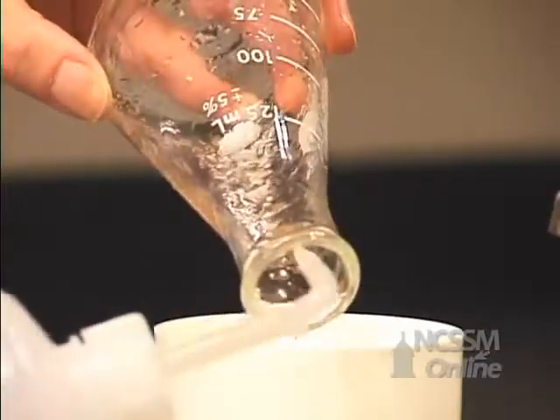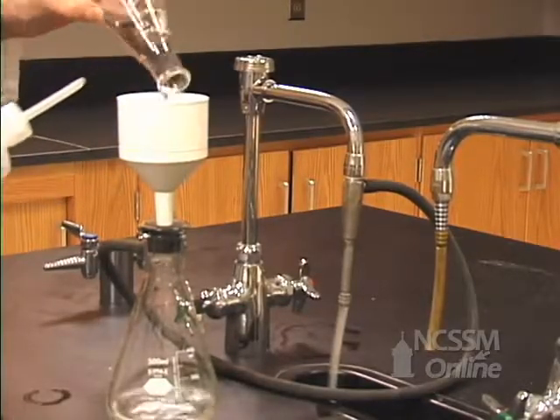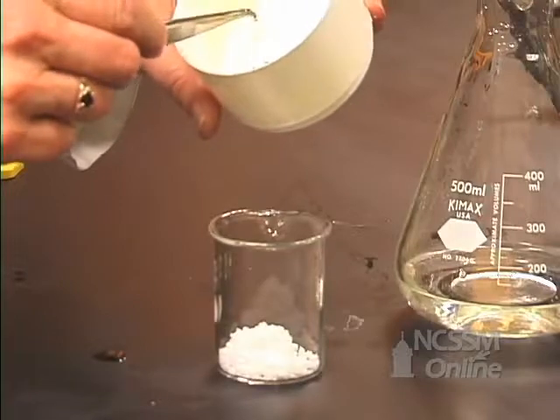We're going to rinse the sides down. We want to make sure we get all of the aspirin into our funnel. You can see here we have lots of aspirin.